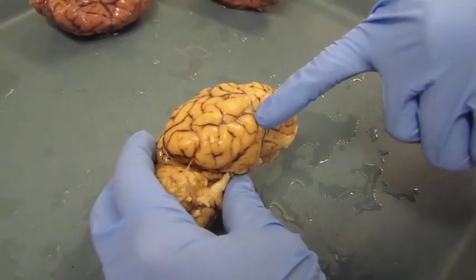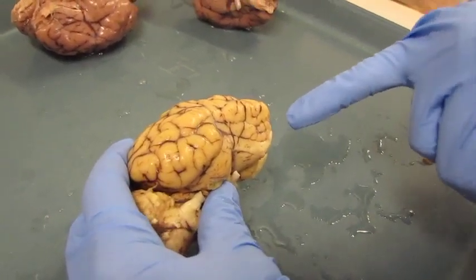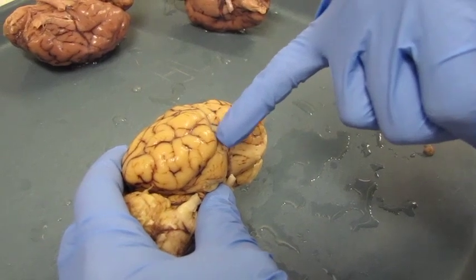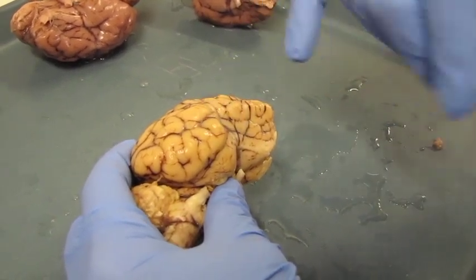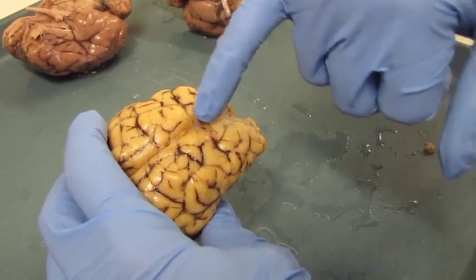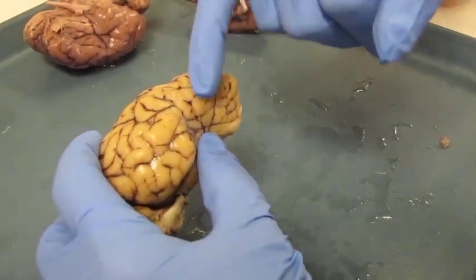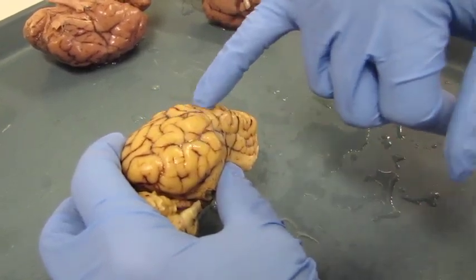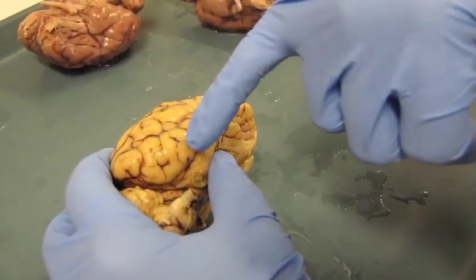You can see all these elevations and grooves here — the grooves are sulci and the elevations are gyri. We're only going to identify a few of these, mostly for helping us locate things. We have one little tiny sulcus here, the pseudo-sylvian sulcus, and the sylvian gyri is right there. Up here, because we have a cross appearing, that's called the cruciate sulcus. Rostral to the cruciate sulcus is going to be our frontal lobe, above our sylvian gyri is going to be our parietal lobe, and caudal to our pseudo-sylvian sulcus is going to be our temporal lobe.